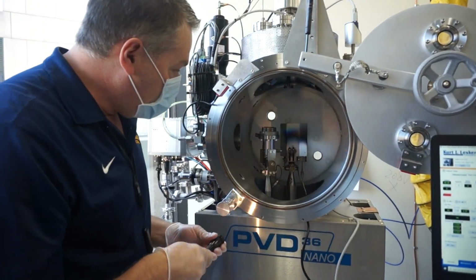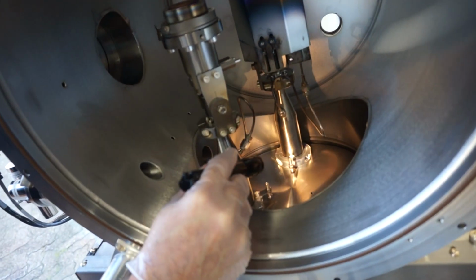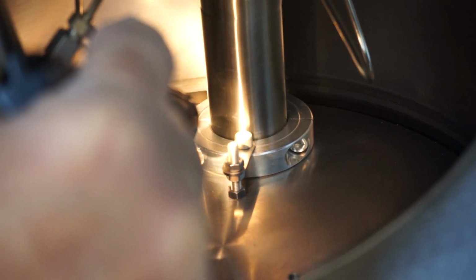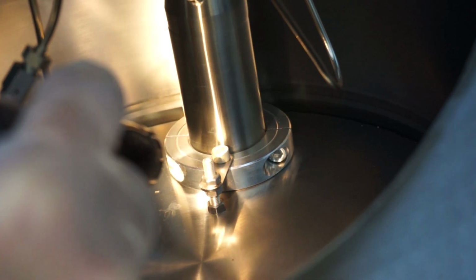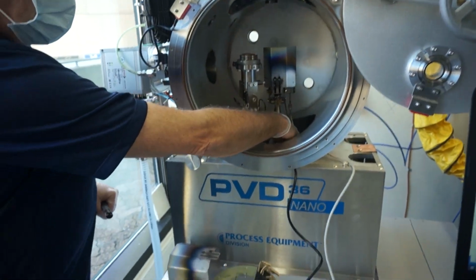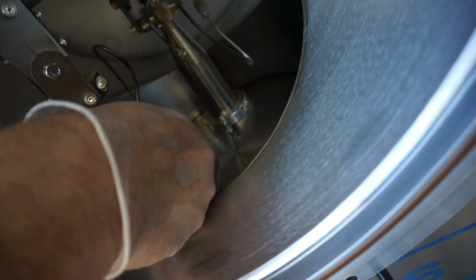But within the chamber, I mentioned the guns. It's a split clamp design on the bottom here, and underneath that clamp is an O-ring and basically a backing plate that compresses the O-ring when it clamps down, and that's what creates the vacuum seal. So you can notice that I could loosen this and I could bring this gun up. We call that insert distance. From the base of this chamber to the underside of this clamp, that's our insert distance.